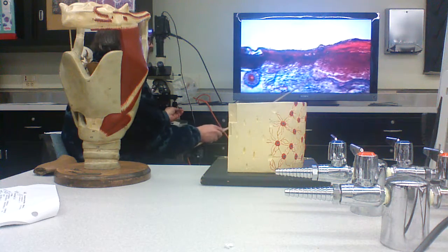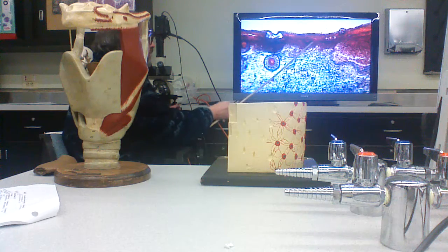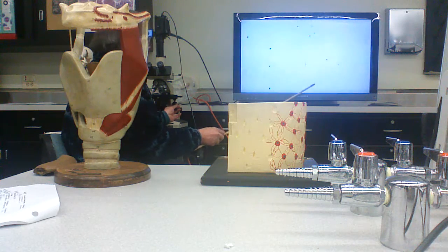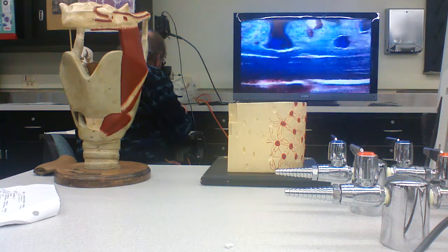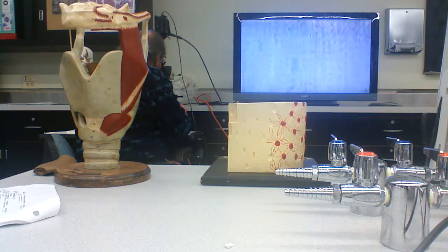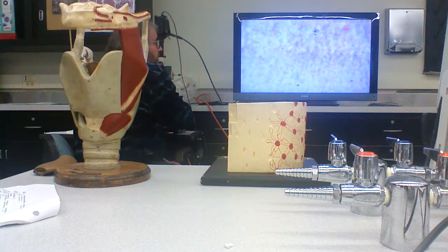Okay? And this is then between, right, the skin and the developing brain, which is actually not in this section. In fact, it's here. This is part of the developing brain.